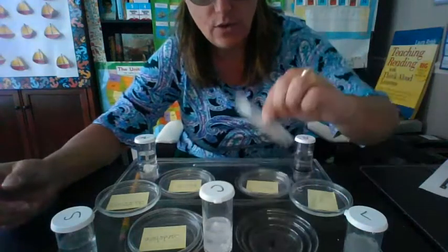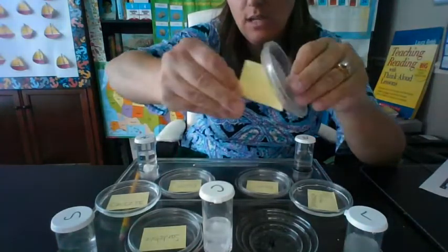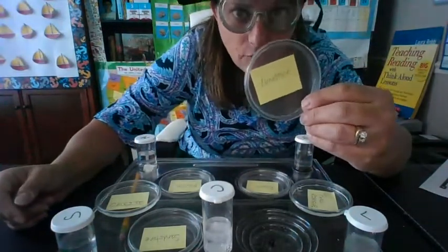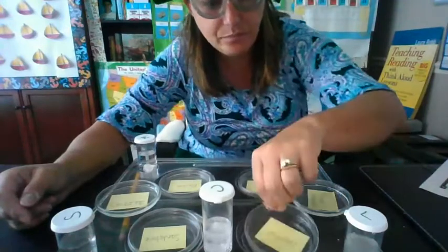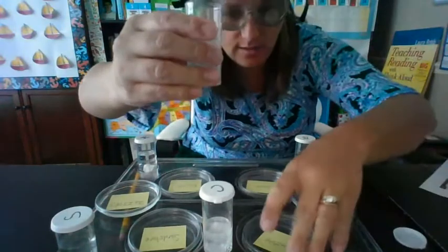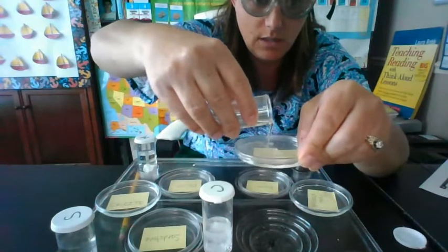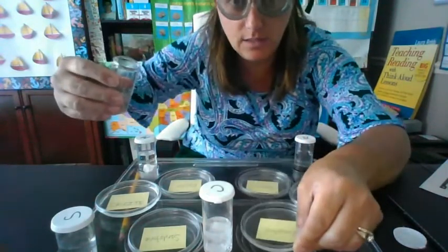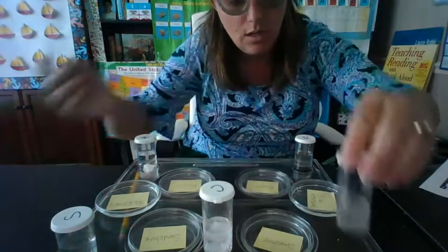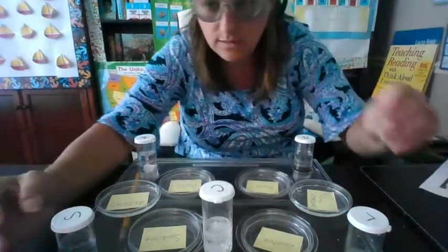Now we have our limestone. If you're wondering what this is, it's just a little sticky note that I put on the back so I can be sure to identify the crystals when they form after the vinegar has evaporated. Then I'm going to take our limestone that's still fizzing away and pour the limestone right in there, cover it up. There we go, and I'm going to stick it right here. And if you're doing this from home with other rock samples, you don't have to have a petri dish, but you could have a small dish somewhere that you're putting the substance in.